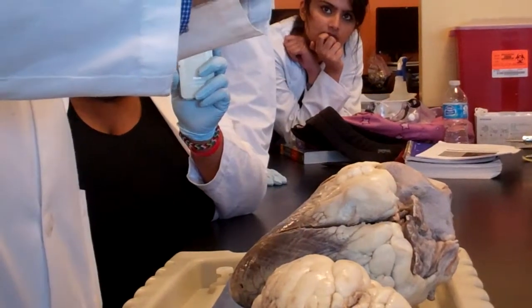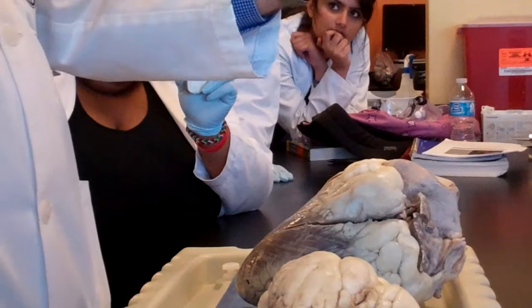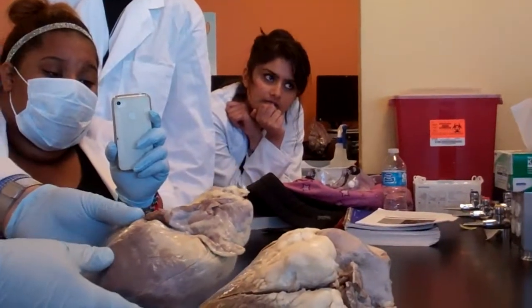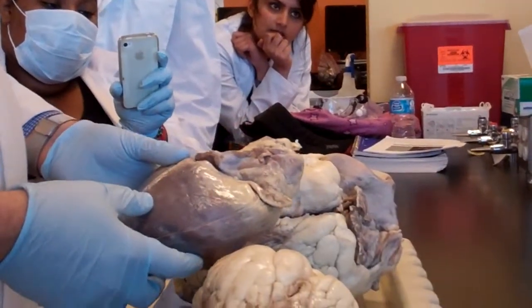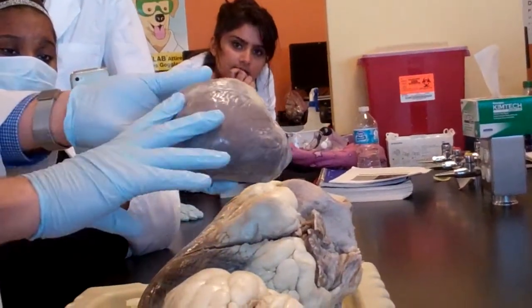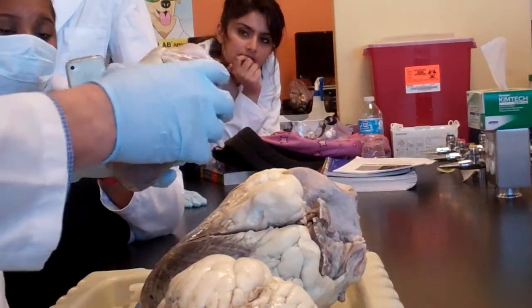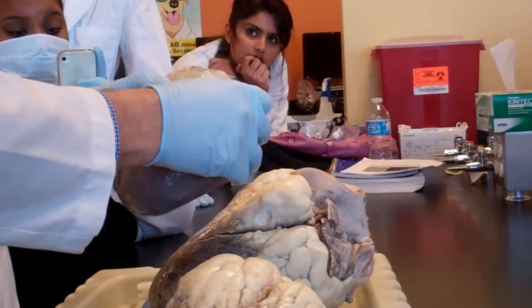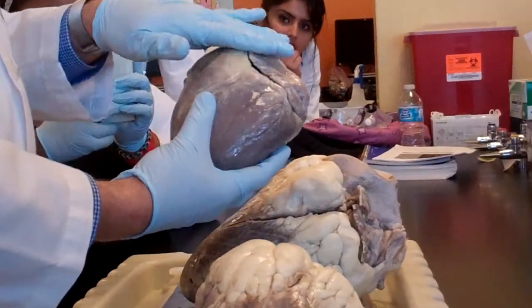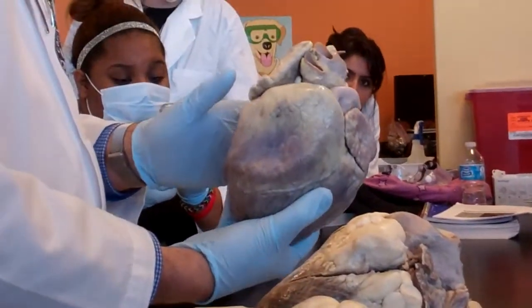I have the person facing me. Alright? And this is the anterior interventricular septum if I make a mistake, but the apex is on the right side. Capiche? Yes? Yes, Anna? Mm-hmm. Now we know why it's wrong? Then this is the correct way. Anterior interventricular septum. Apex of the heart. It doesn't have to be pointed like this. It's apex, right? Auricle on the left-hand side. Auricle on the right-hand side. Arterial side. Venous side. Okay?